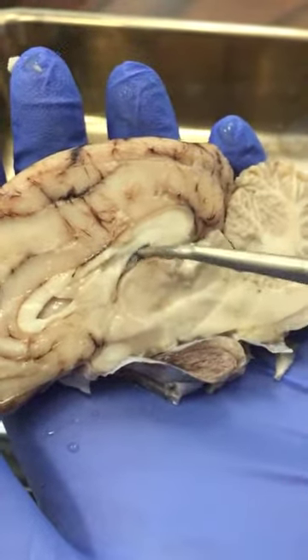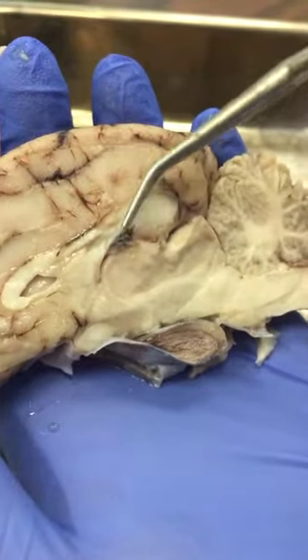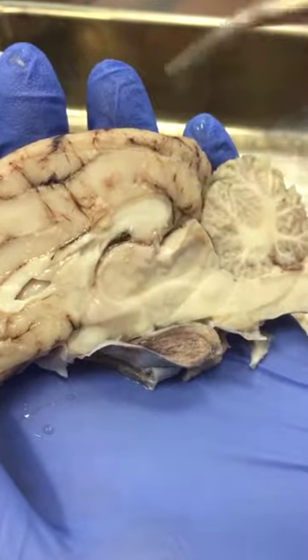It starts to create a circle. Complete the circle. That is the thalamus. On the top of the thalamus, you should expect to see choroid plexus structures, part of the blood vessels.